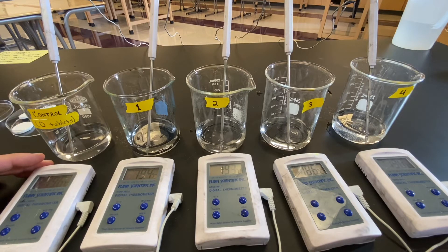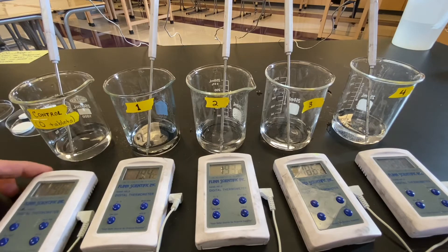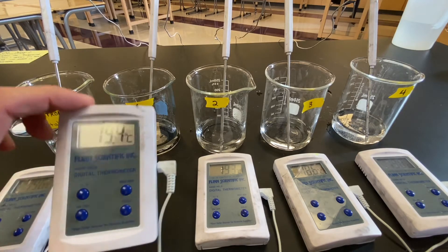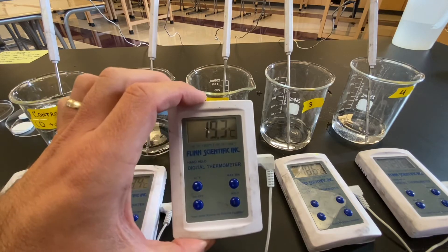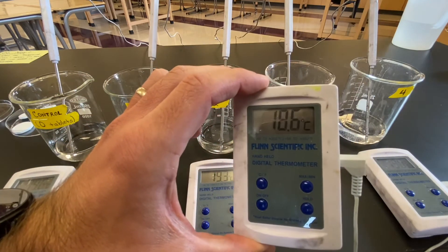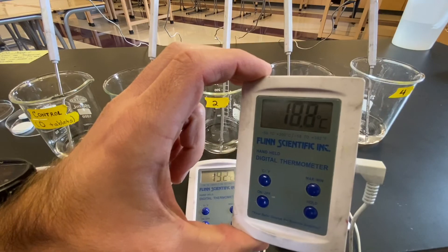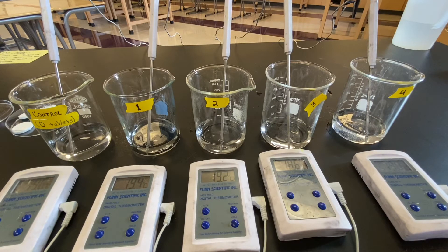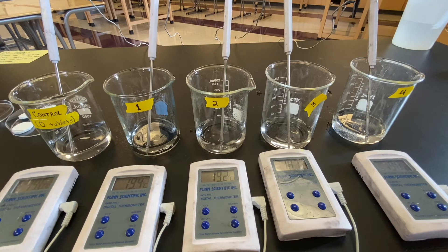What I need you to do right now is start recording the temperature for the water in each beaker in your data collection chart. Beaker zero: 19.6 degrees Celsius. Beaker one: 19.4 degrees Celsius. Beaker two: 19.3 degrees Celsius. Beaker three: 18.6 degrees Celsius. And finally, beaker four: 18.7 degrees Celsius. We're recording the initial temperature of each one of these five beakers. If you need more time, pause the video and record your initial temps.